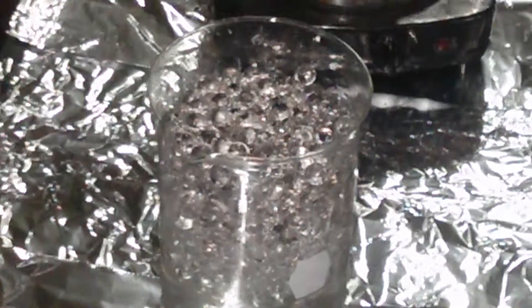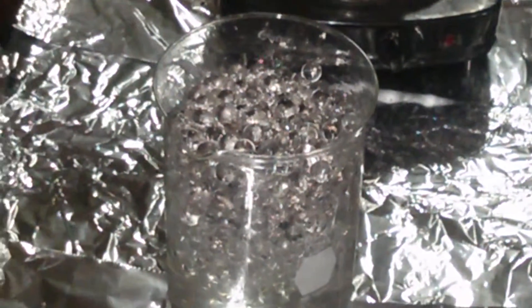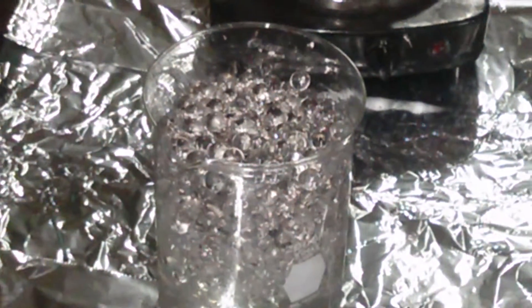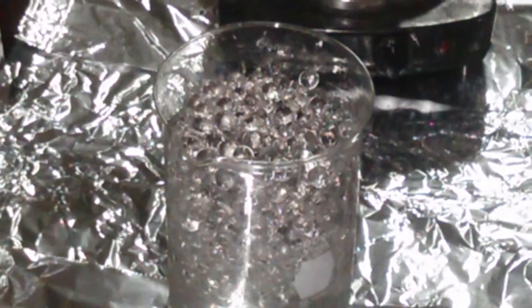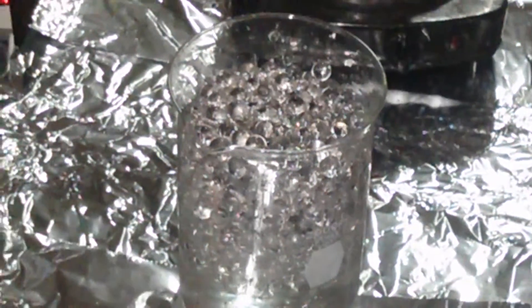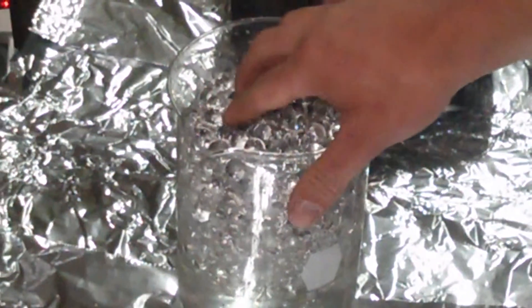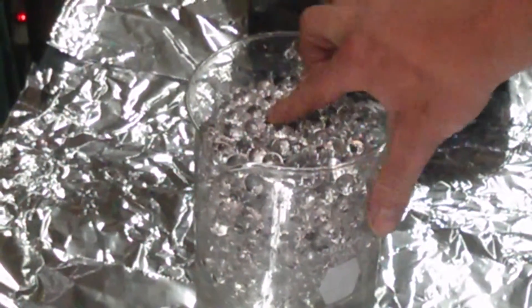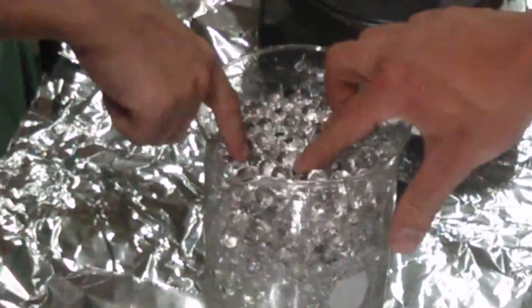Anybody want to try and lift it out? How did we get it out last time? Carefully. I can touch it. It's kind of warm, but not that warm, right?